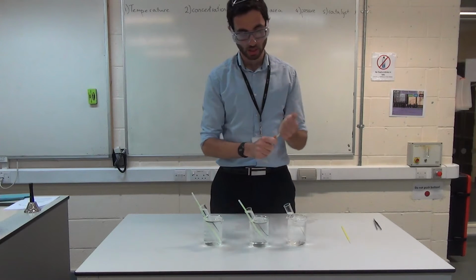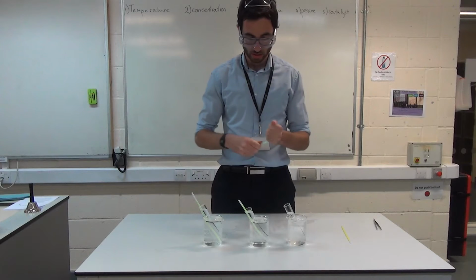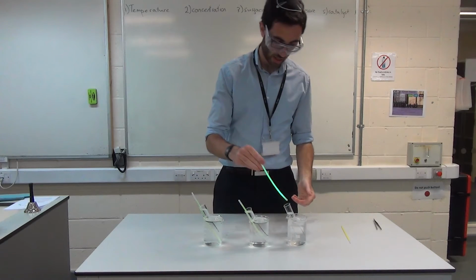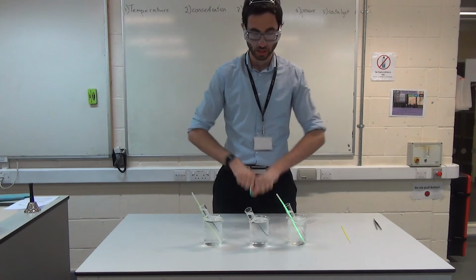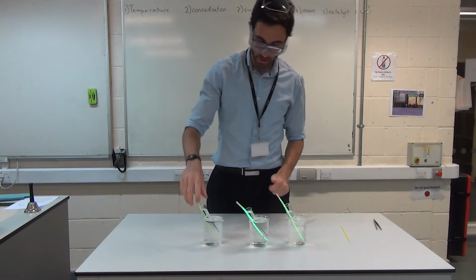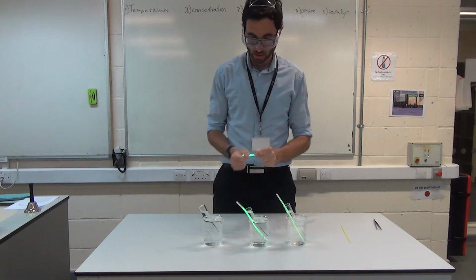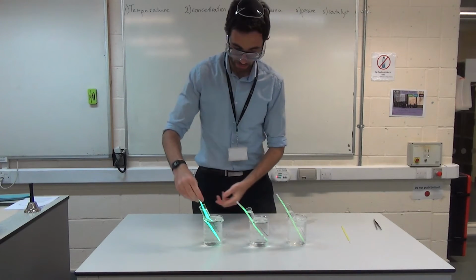So what I'm going to do is I'm just going to crack this one up. Give it a really nice shake. And pop it in. I'm going to do the same for this one. I'm going to turn the lights off in a second so we can see. Give it a really good shake. And pop it in. I'm going to do the same for this one. I'm going to crack it up. Give it a really good shake. And pop it in.